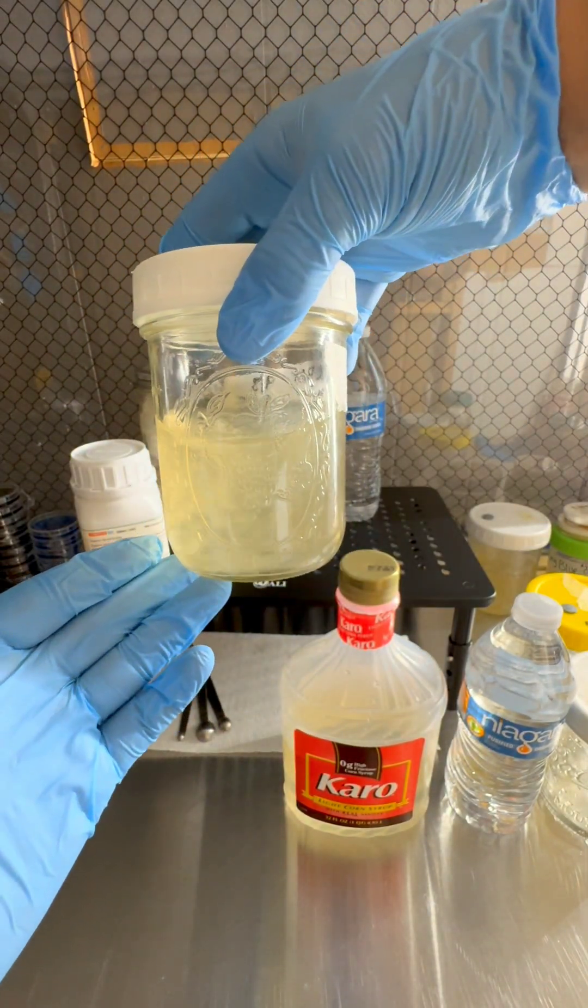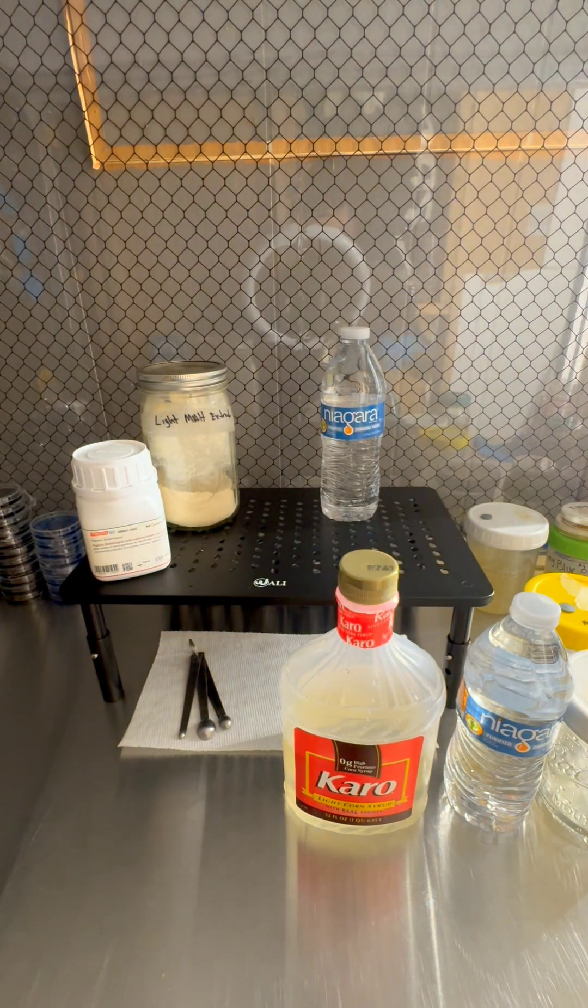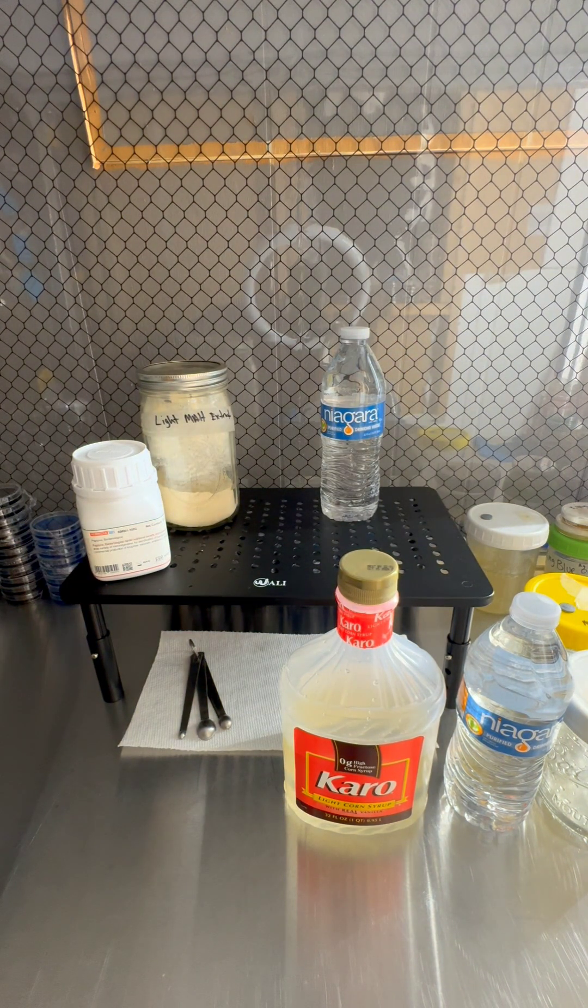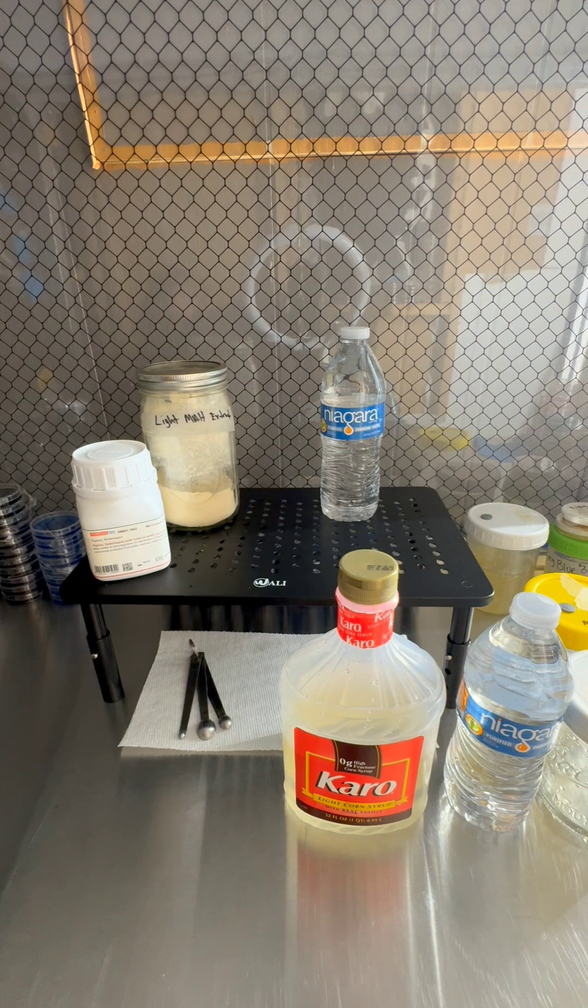So that's what my recipe gets you. I like my liquid culture clear and I like it thick.